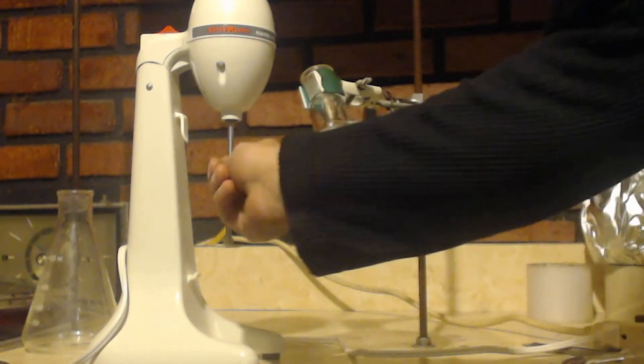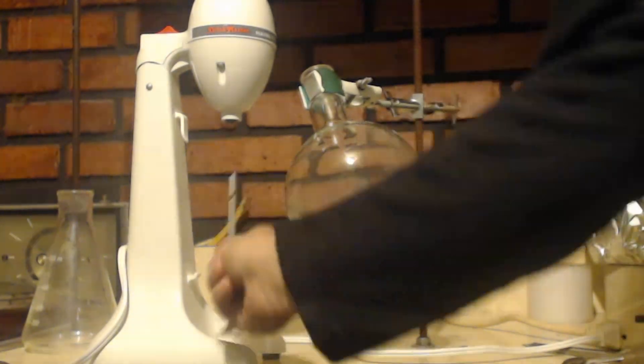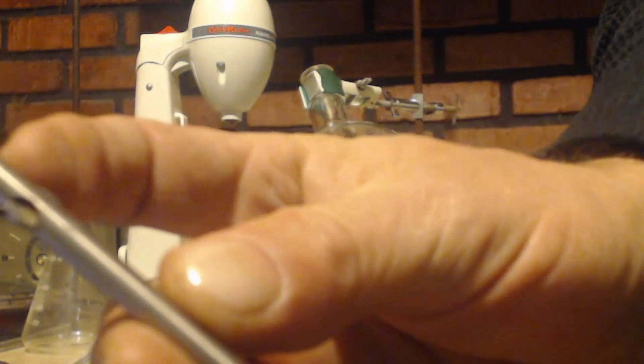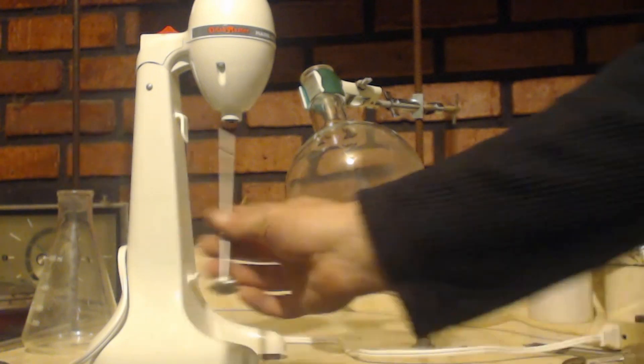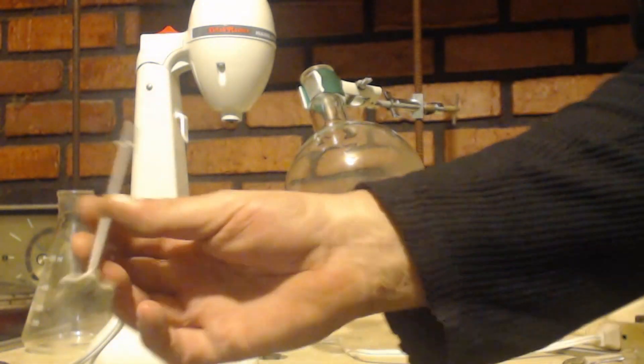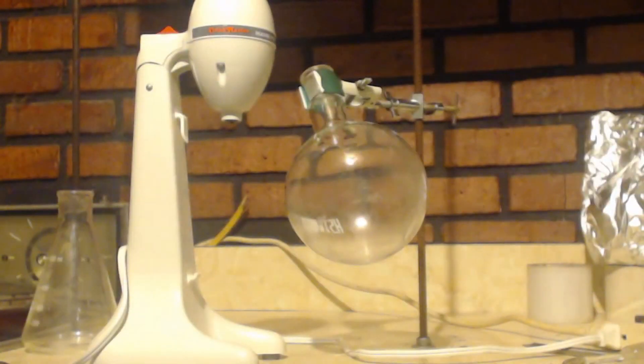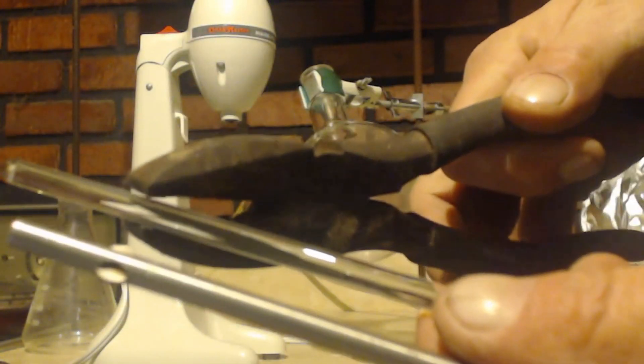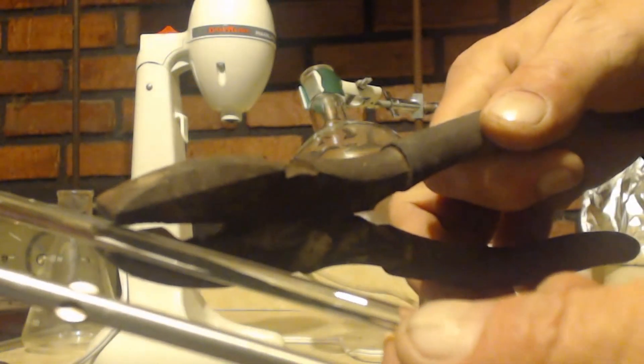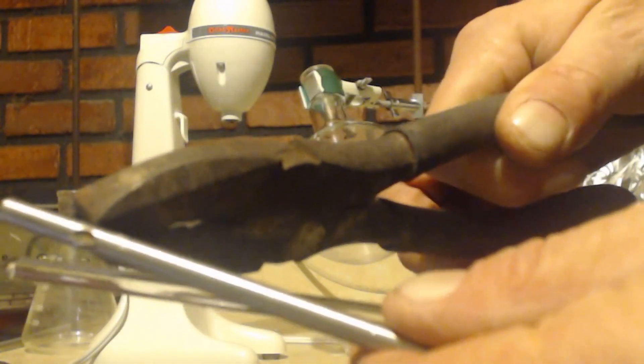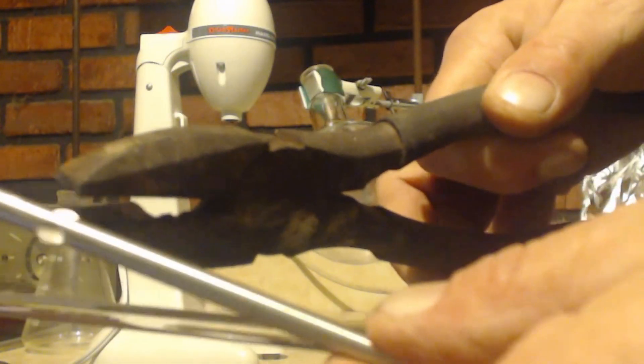Now this just comes out. You can see there's two little divots to come out, and that's what makes it stick into the blender without flying out. If you can do that indentation with some pliers, you know, get some pliers, heat this up and just squish it.